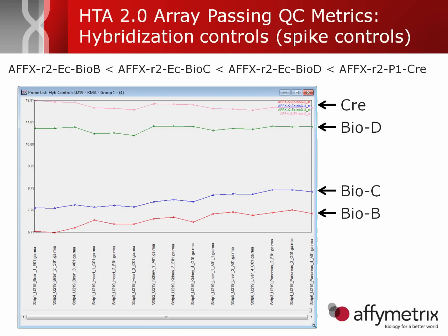The HTA array passing QC metrics for the hybridization controls, or the spike-in controls. These have been spiked into all of the assays, and the expected behavior is that bio B should have the lowest signal estimate, followed by bio C, followed by bio D, followed by CRE. If this is not the case, then perhaps something has gone wrong and you should further investigate what is going on with the array.